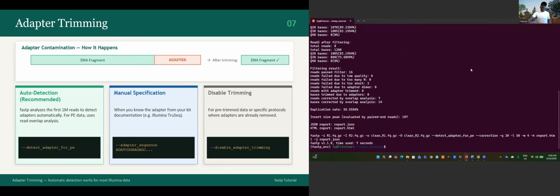So the adapter, this is just what the adapter trimming does. FASTP can auto detect up to 1 million reads, and the command, when you run FASTP, but you can also do the manual specification if you know what you want to detect, when you know the adapter from your kit documentation. Or if you already know that you don't have adapter, or your adapters were already removed, you can disable the adapter trimming. You just use this flag in the command line, --disable_adapter_trimming. That will disable the adapter. You will not have the adapter analysis.